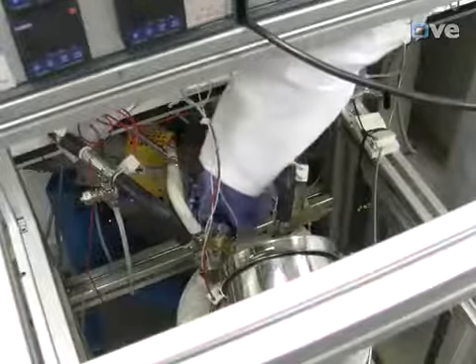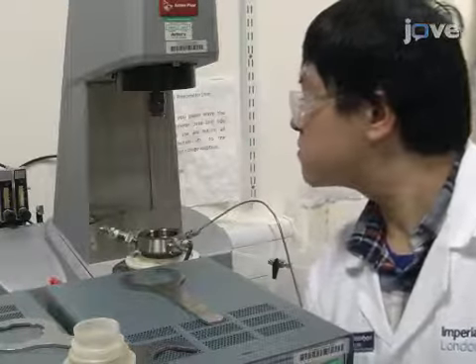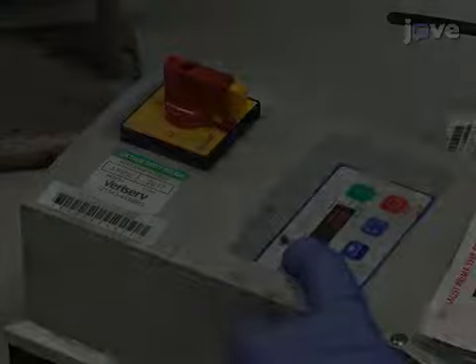Open the oil valve downstream of the mixer and monitor the double gap geometry. Once the inner part of the double gap geometry is just barely immersed in oil, open the gas relief valve to depressurize the system. Start the gear pump and adjust the rotation.